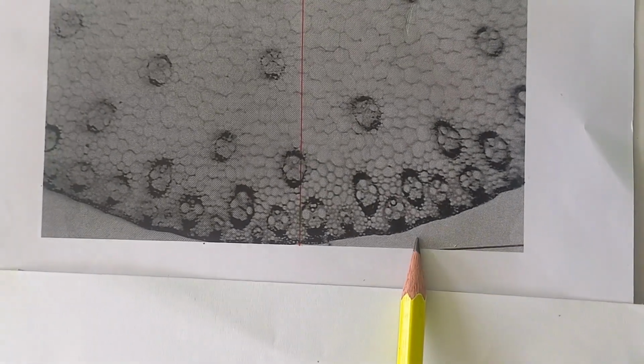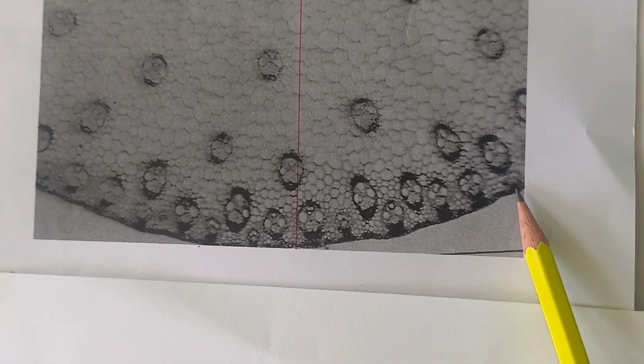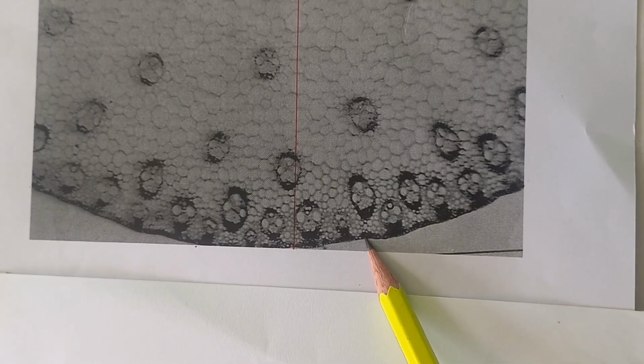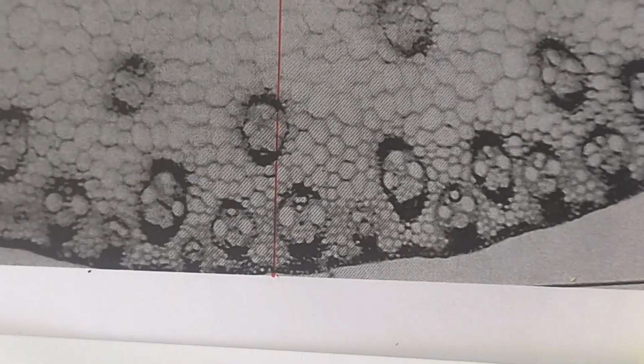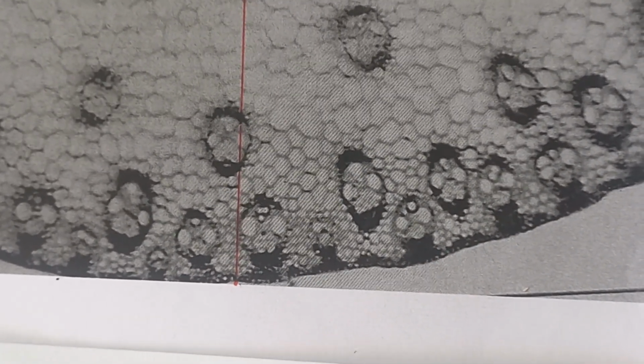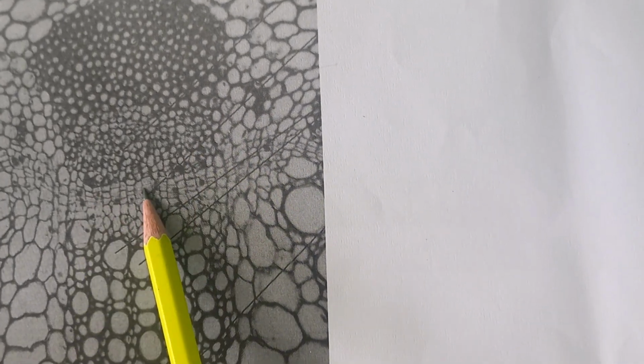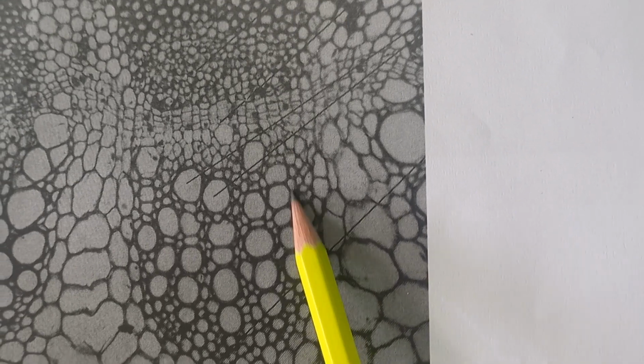This is a transverse section of a monocot stem. Now, these areas form one tissue. In these ones, you don't need to draw in the individual cells. So, what is a tissue? A tissue is a group of similar cells that perform the same function. So this vascular bundle area here is one tissue. That's the sclerenchyma. Another area here is another tissue, phloem, another tissue, cambium, and another tissue, xylem.